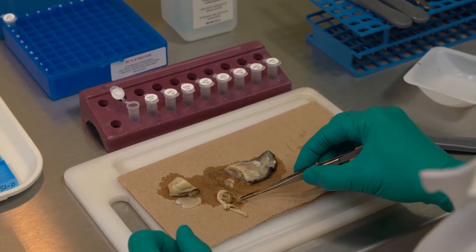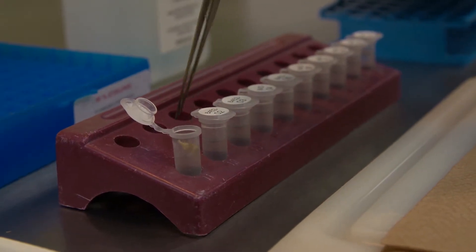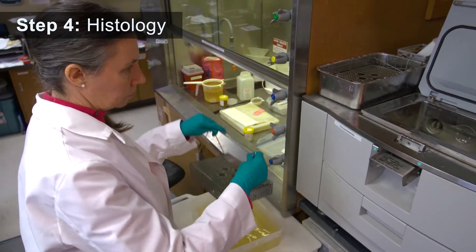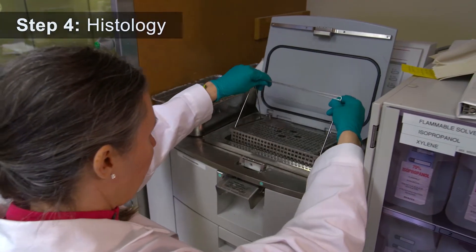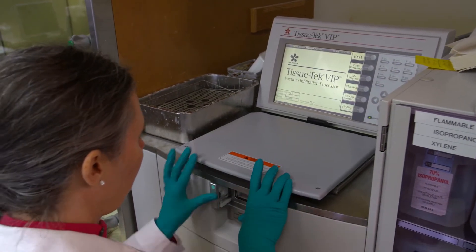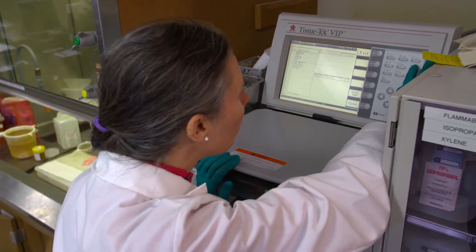Any lesions or abnormalities are removed for additional testing. In the histology lab, preserved samples are transferred to a tissue processing machine, which removes all water and infiltrates the tissues with paraffin wax.